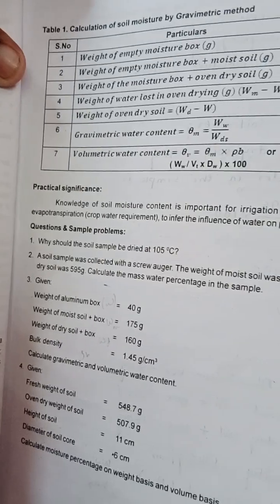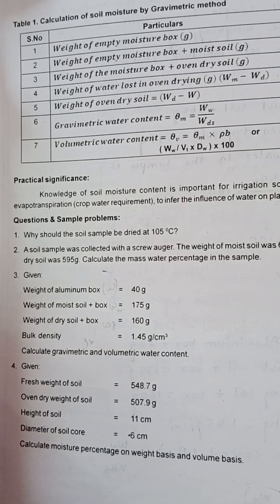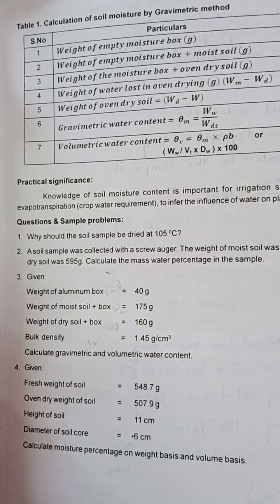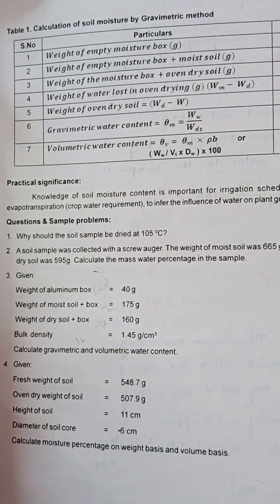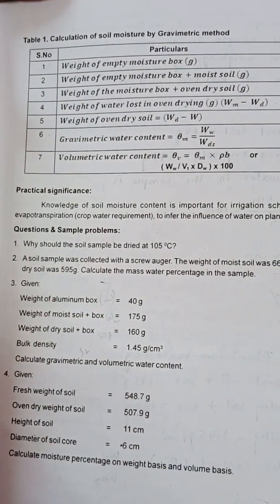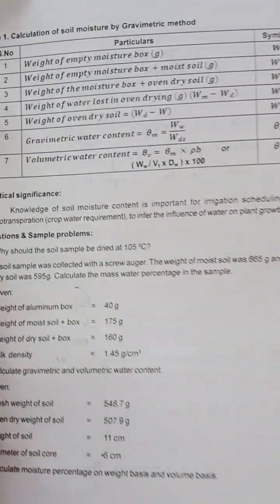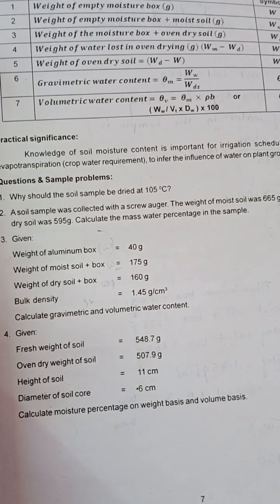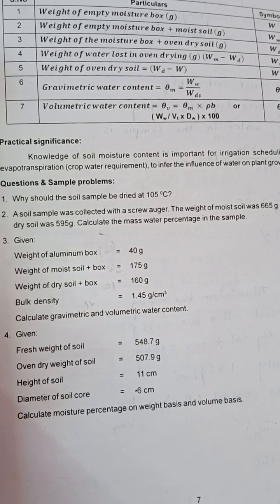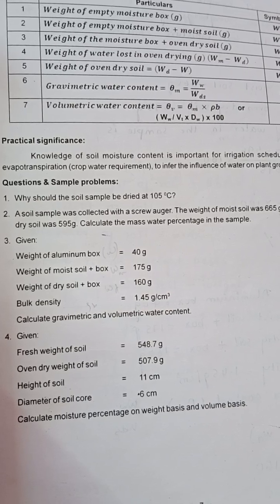The practical significance of determining gravimetric and volumetric methods is that we can analyze the importance of soil moisture content and gain knowledge useful for irrigation scheduling, computation of evapotranspiration, crop water requirement, and to understand the influence of water on plant growth and development. We learn from this practical how much influence water has on plant growth and development using gravimetric and volumetric methods.